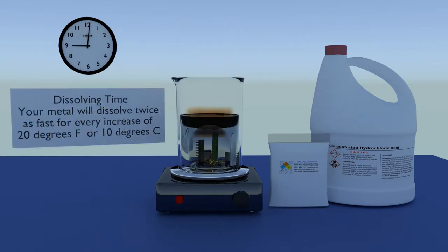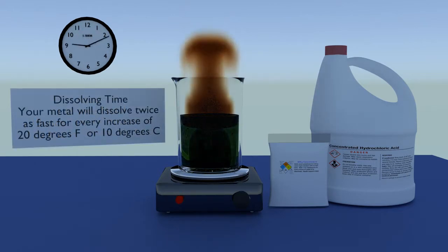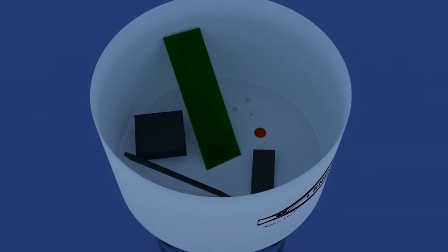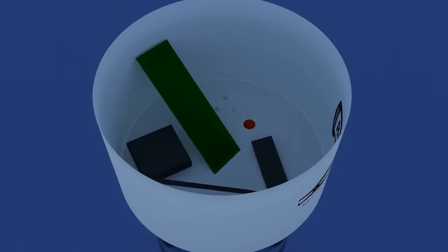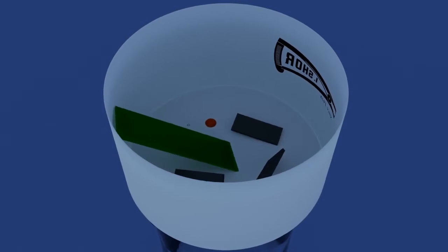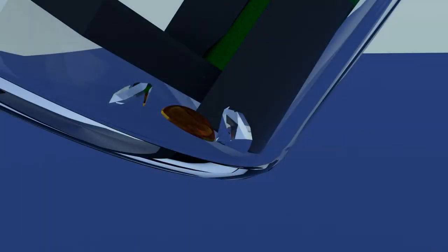Heating will significantly reduce dissolving time but will also significantly increase fume production. After all the metal is dissolved, it is common for some materials such as stones, ceramics, plastics, etc. to be left behind undissolved in either your beaker or your filter funnel.